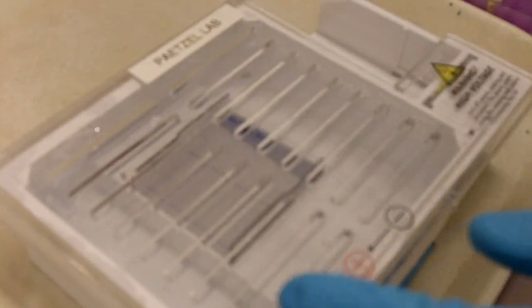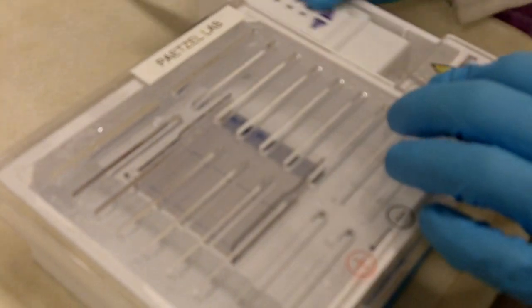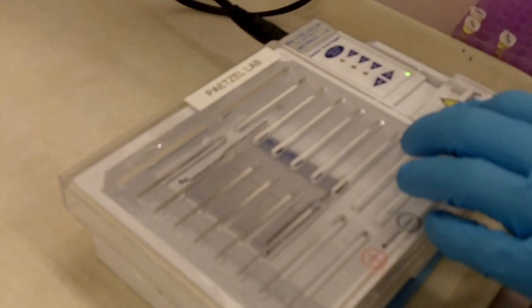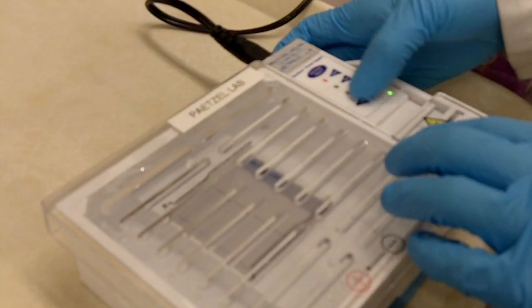After the sample has been loaded, we'll put on the lid and then we'll hook up the power supply and then we'll run the gel.